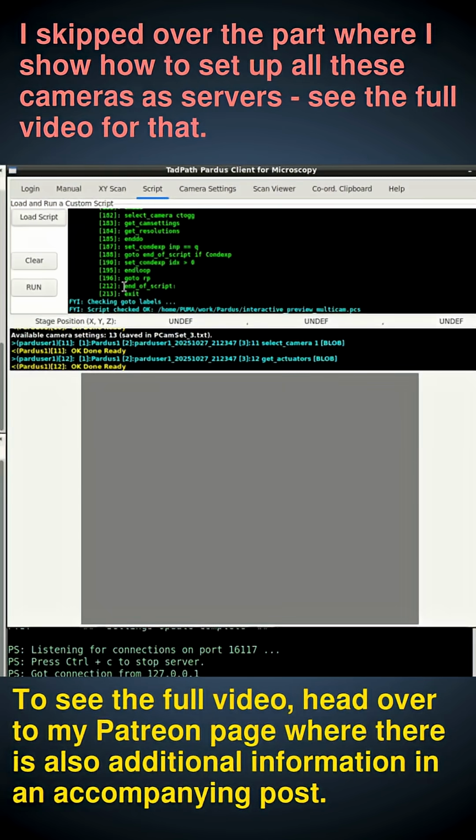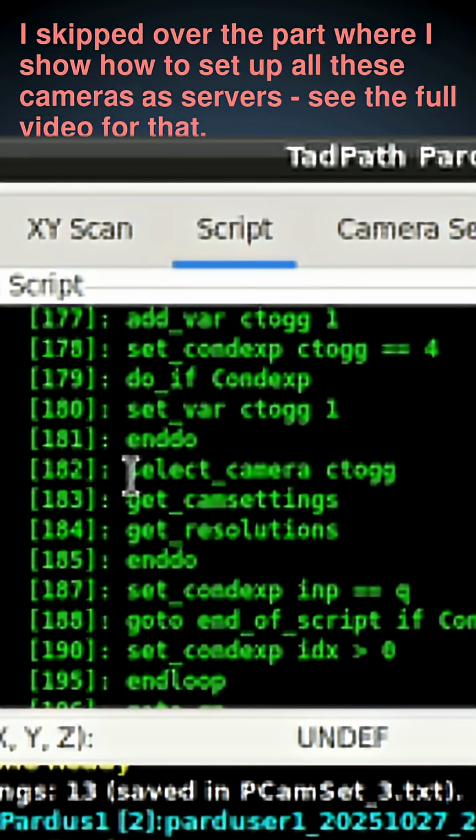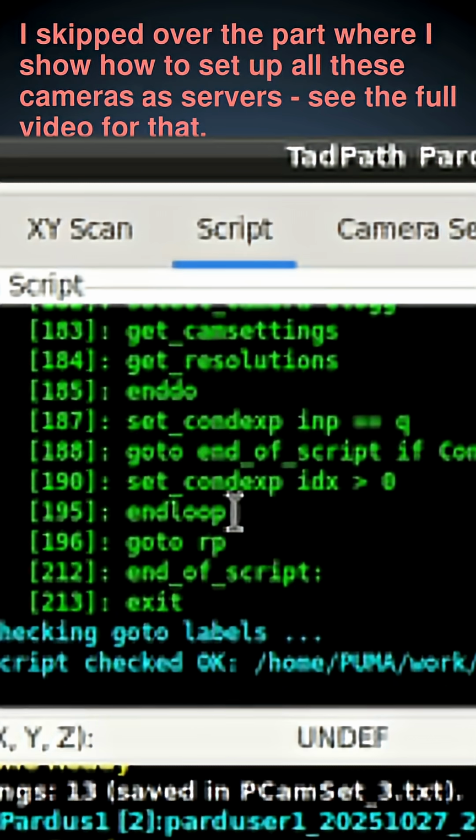This is an interactive script. Of course, it doesn't have to be interactive, but this is just for demonstration purposes. And if you look at the code of the script, here, this is the key line that selects the different camera. It's simple as that. It's just select camera and then a number here in the variable, which I'm calling tog, and I'm going to cycle this variable between 1 and 3. So I'm going to keep adding 1 to it, and then when it reaches 4, I'll put it back to 1. So it goes 1, 2, 3, 1, 2, 3 every time I press the camera button.